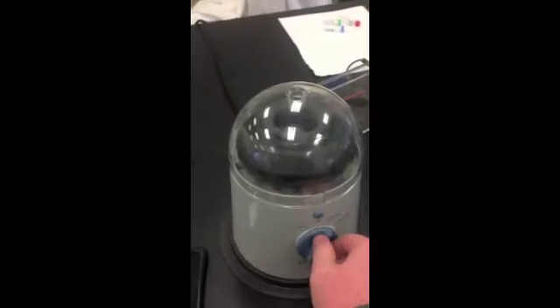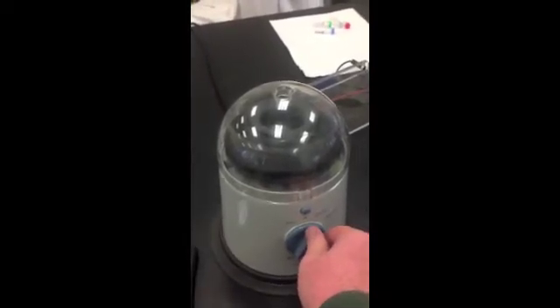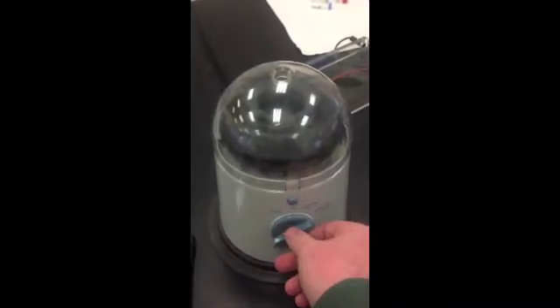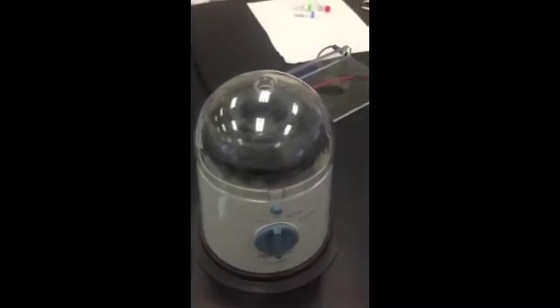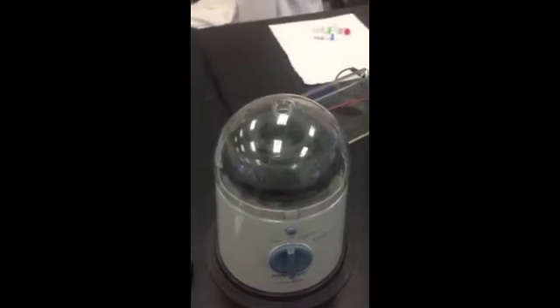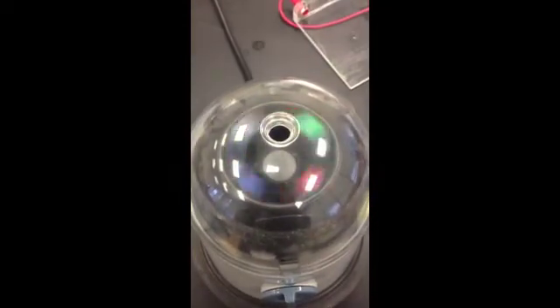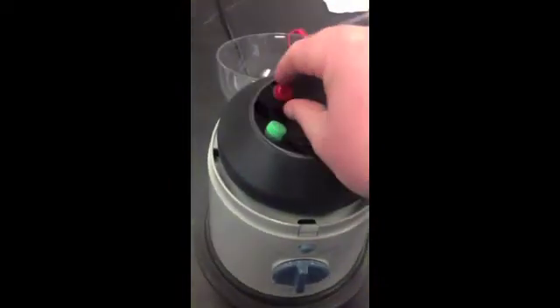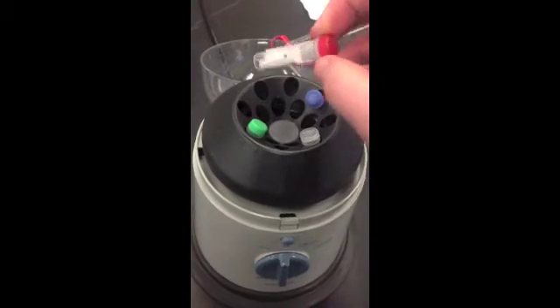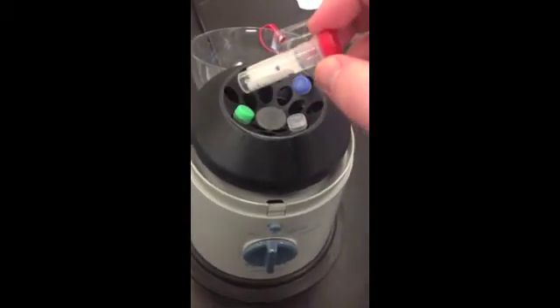So here's 6,000 rpms. As soon as you bump it up to 10,000, it's going to really give a kick. So if you're not holding on to it, the whole thing kicks. So you want to make sure you're holding on to it. Leave it for a few seconds. Turn it off. We'll let it stop spinning. And we can pop it. And you'll see that that sample that was spread out everywhere is now concentrated all at the bottom of that vial.